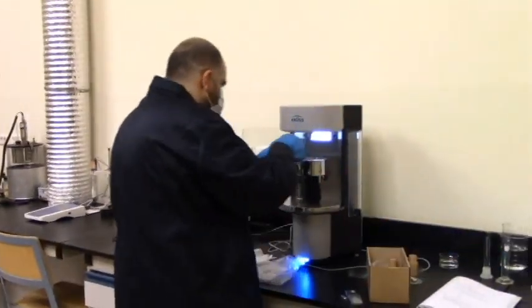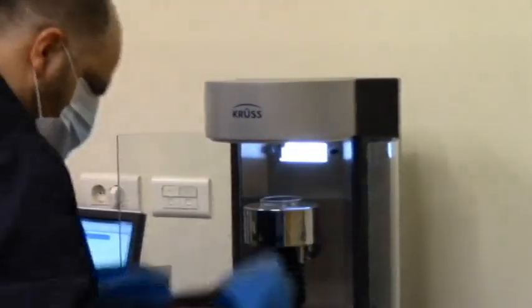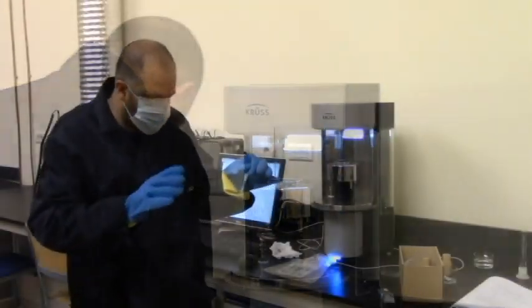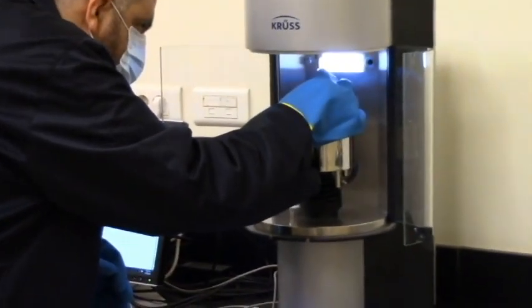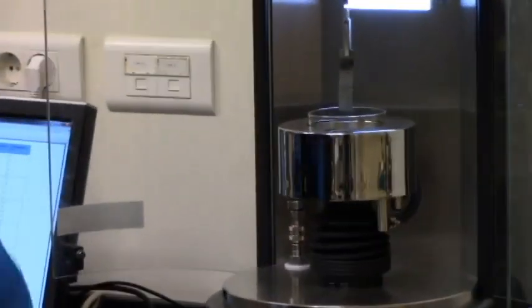So this is to be placed here in the second vessel. The zinc plate has been cleaned. This is the zinc plate. After being cleaned, it's hooked up here. Remember, the zinc plate is like our piece of rock. It will never be exposed to flame. Flame is just for the standard plate.